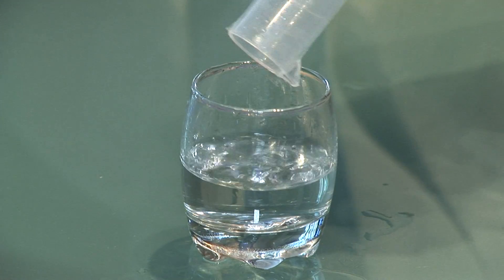Hello, I'm Paul Hisco from PH7, and today we're going to show you how you can measure the ethanol strength in vodka. We have here 25 milliliters of vodka from a well-known brand which claims to be 37.5% alcohol.